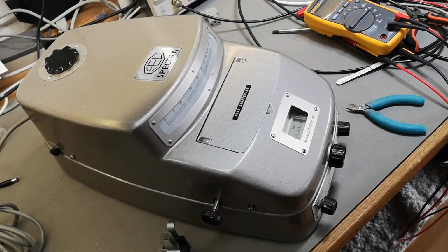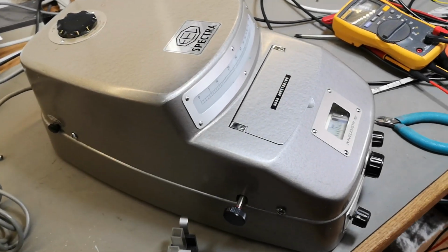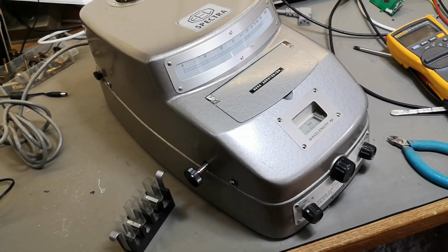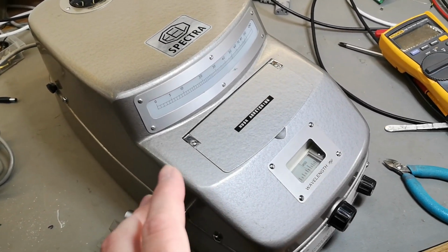Welcome to a new test and teardown video. This is something completely different. It is really big and special, this unit. I think I figured out what this one is.